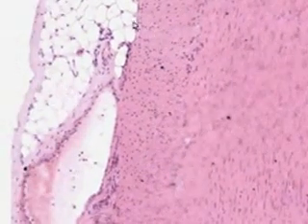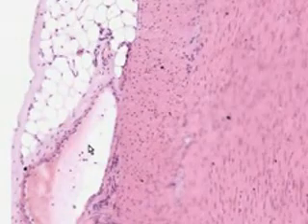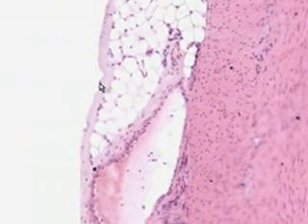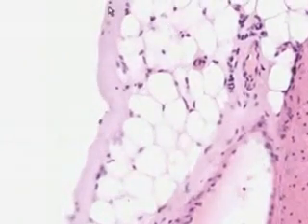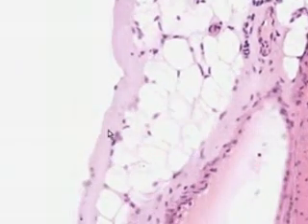Notice we have some connective tissue of the serosa, blood vessel, artery, vein, fat, connective tissue, and last but not least, these tiny little cells all the way out on the surface are the mesothelial cells, like here, possibly here, but definitely here, probably a couple here which are slightly out of focus.